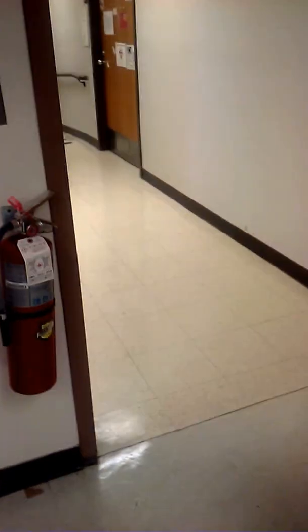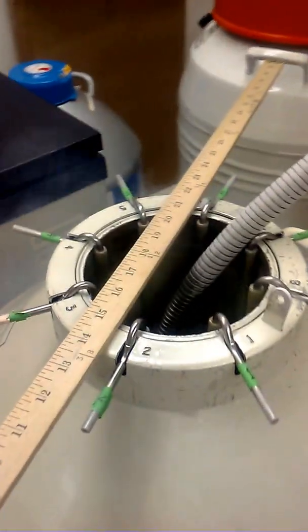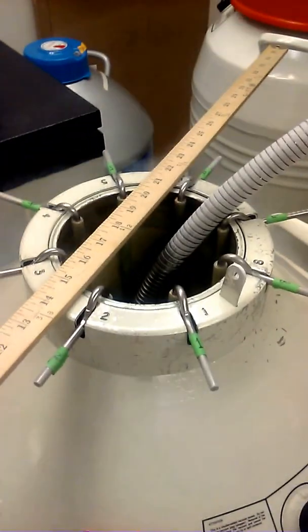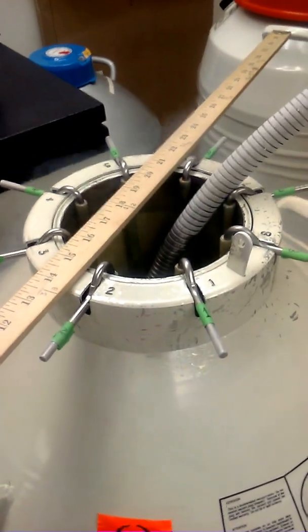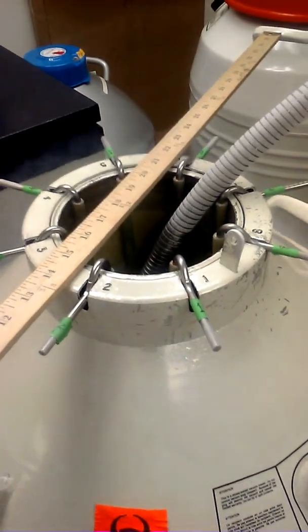Sometimes if you don't have a door open, you might want to use a fume hood. It should always be done and the tank should never be left alone until everything is complete.